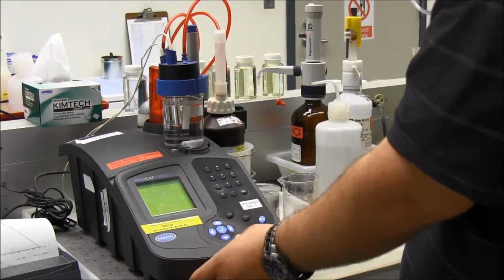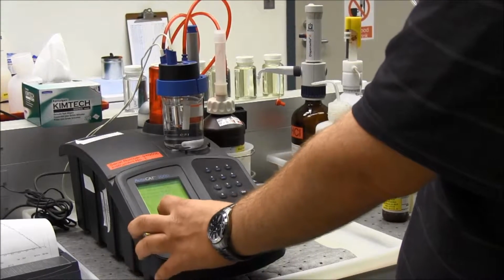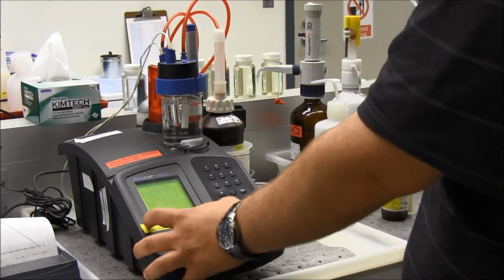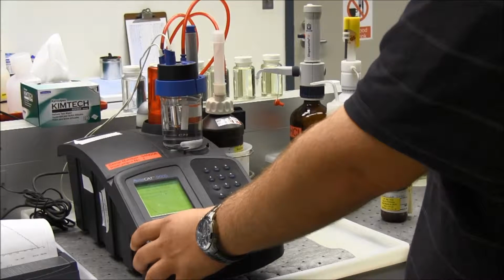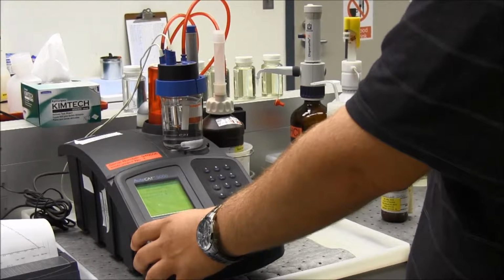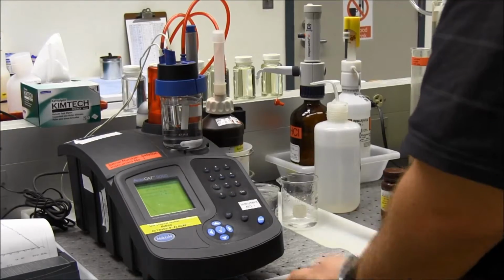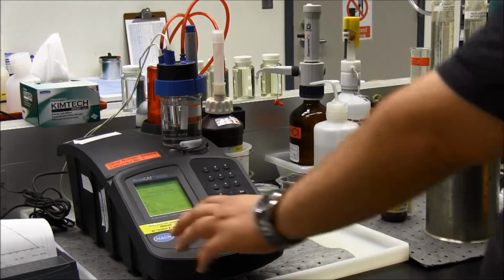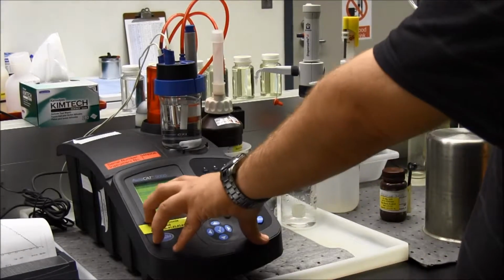Since I don't have a lot of noise in that sample, I'll go to the second cursor, and I'll move that just before the endpoint. Third cursor just after the endpoint. This fourth cursor is way out here, so I'll just leave it alone from there. I'll hit OK, and now this will give me my actual result. It'll give me the nice flat line again. I'll hit OK. And here's my results.